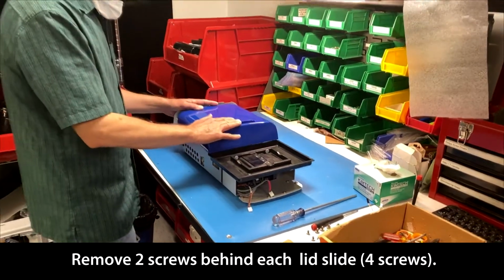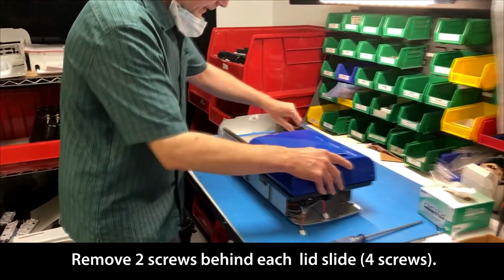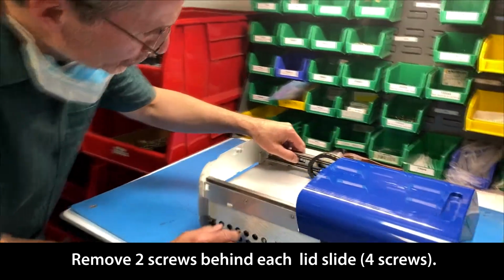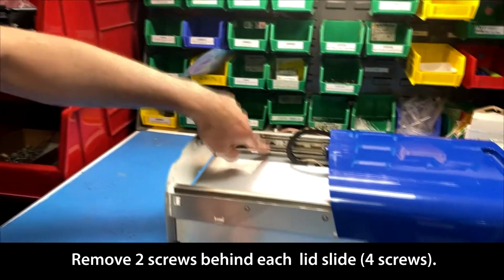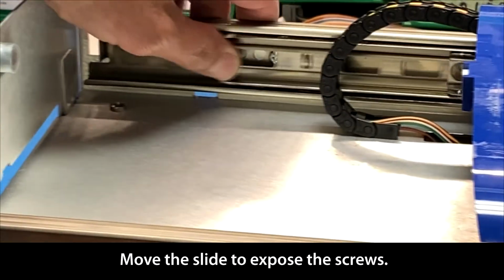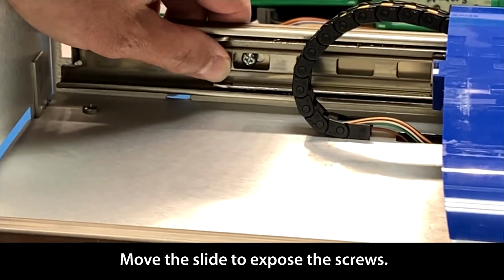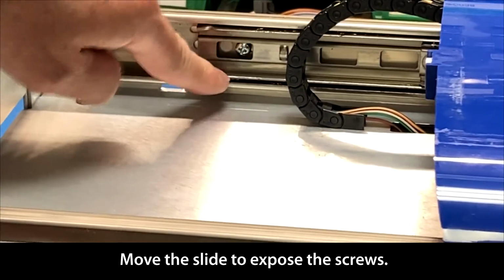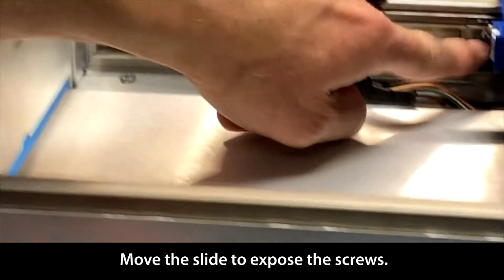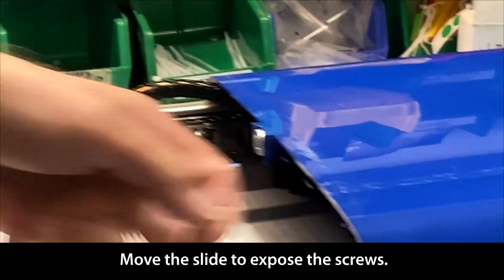Now we're going to take off the blue lid. There's going to be 4 screws, 2 on either side, okay? You've got a slide here. If the screws aren't exposed, you just want to slide this back and forth to expose your screws. So you've got 1 there, 1 right there, and 2 in the same place on the opposite side.